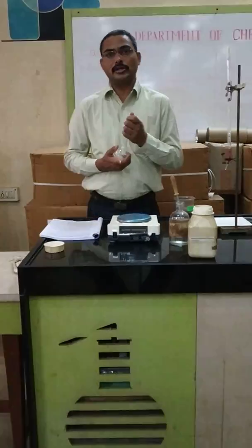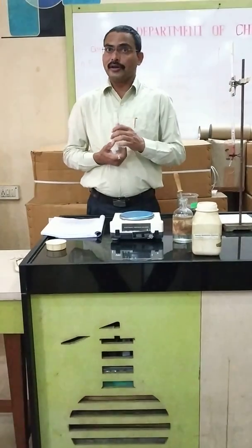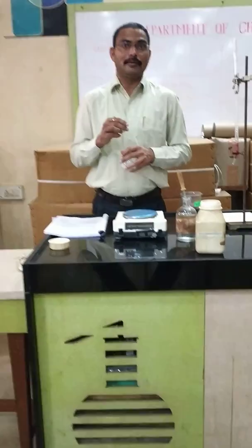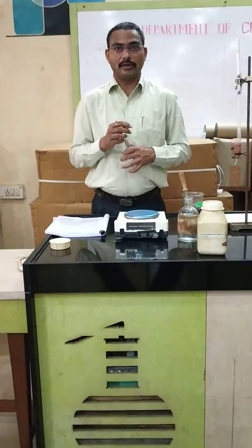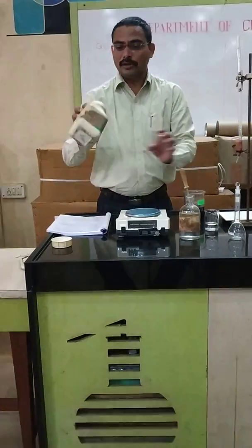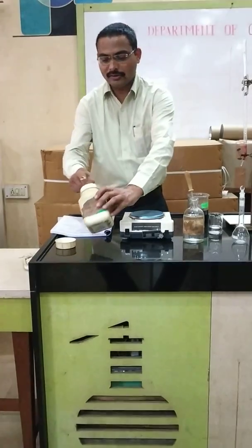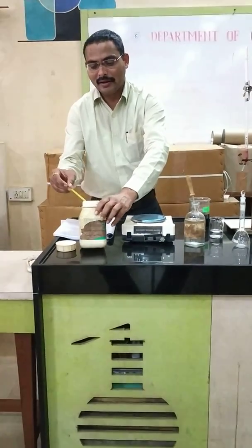The first part is the preparation of the standard solution of ferrous ammonium sulfate, that is 0.1 molar. This is also an activity for our new syllabus — preparation of 0.1 molar ferrous ammonium sulfate. For that purpose, we have to take 3.92 grams of ferrous ammonium sulfate on this weighing machine, that is a digital balance.